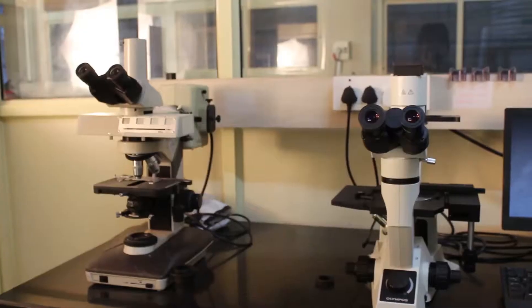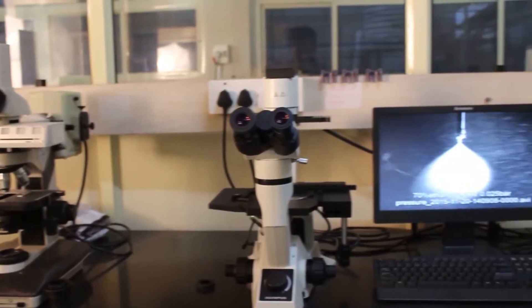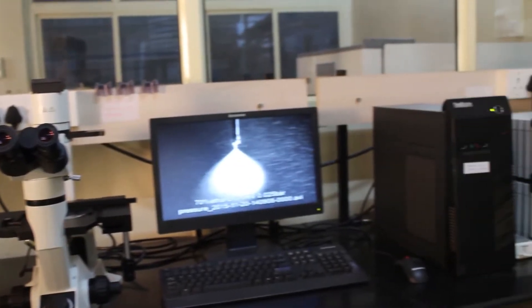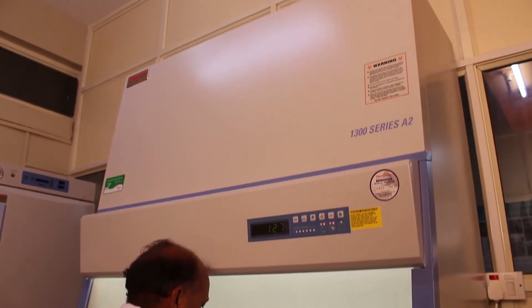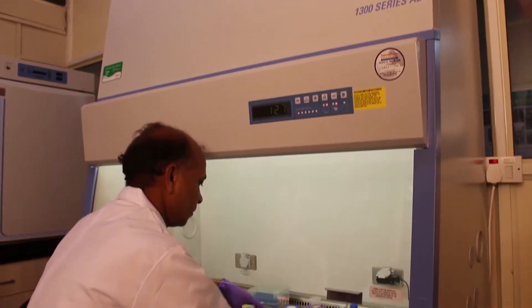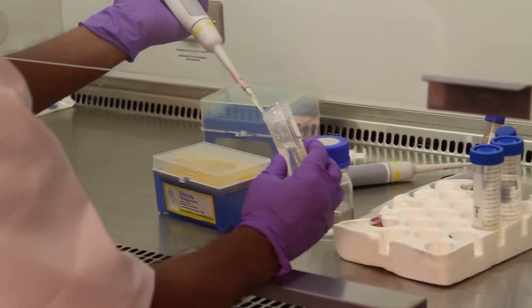Animal cell culture and nanotechnology laboratory, a BIRAC, GOI-funded lab, has electro spray for nanodisc making, biosafety cabinets class 2 A2, CO2 incubator, deep freeze, inverted and fluorescence microscope, etc., which can be used for animal cell culture work and drug or diagnostic development.